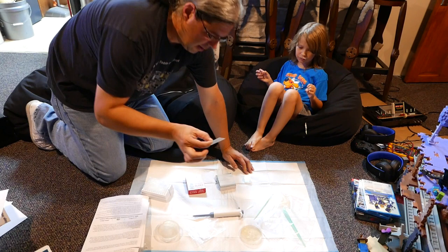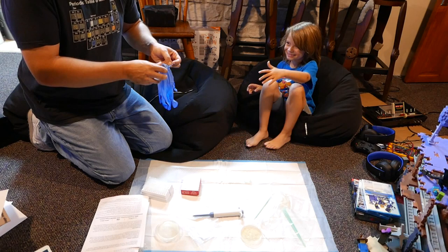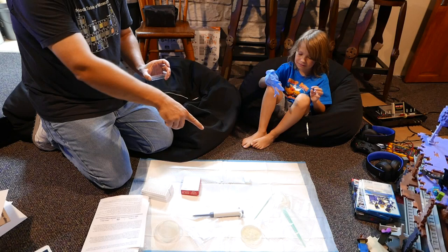You want to put it on there? Yes. Does that mean I need to wear gloves again? Yeah, that would not be a bad idea. Why don't you slide one of your hands in there? Wait, I'm using my right hand. I didn't do the best I could. So, you take, with that hand — don't touch down there. See, now that's the whole point.